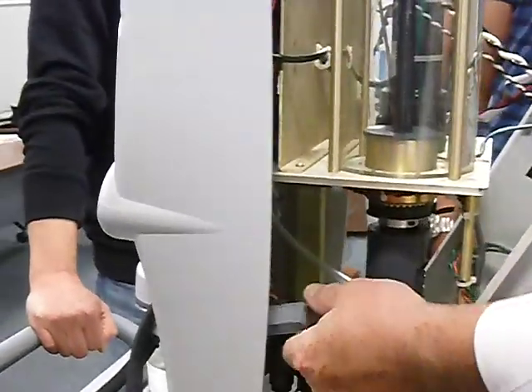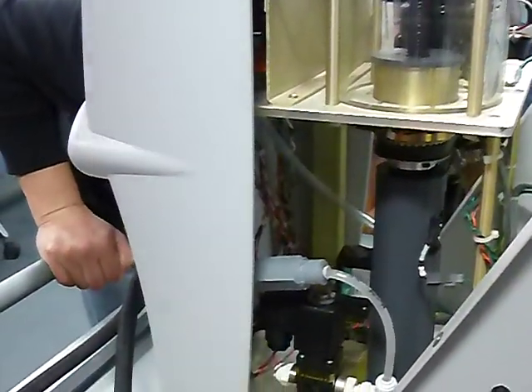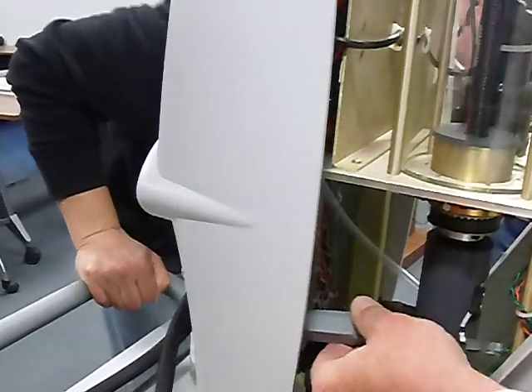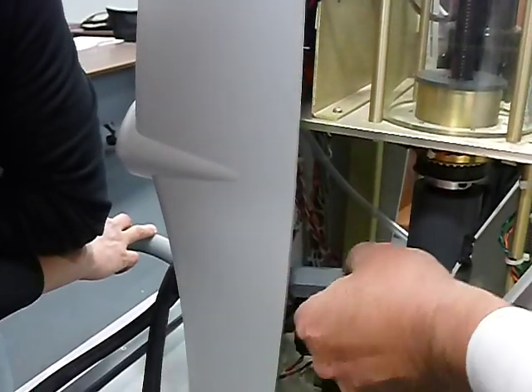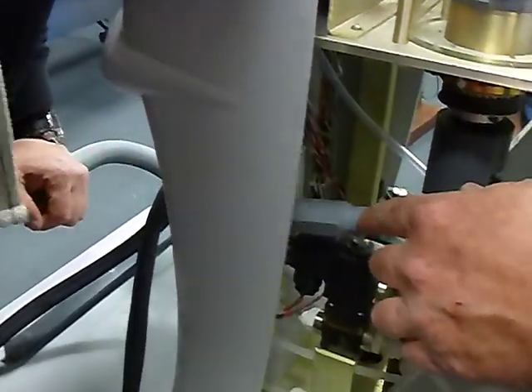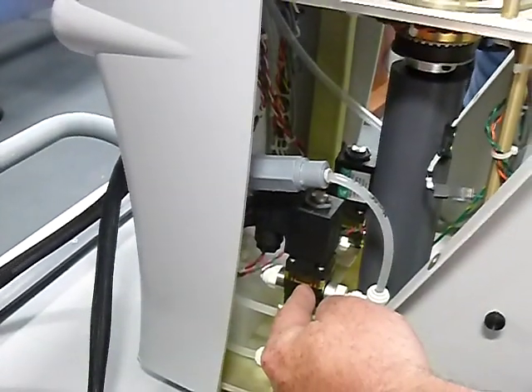So it's going to go in here, and inside this loop, I think it's all polypropylene. Yeah, it is. If you see inside this loop here, there's a direction of flow. One way. See the valve? And there's a small orifice in there. So it's going to go in here, down through this loop and around. And when it sucks it in, this solenoid is going to open up. Okay? Where do you think it goes next?